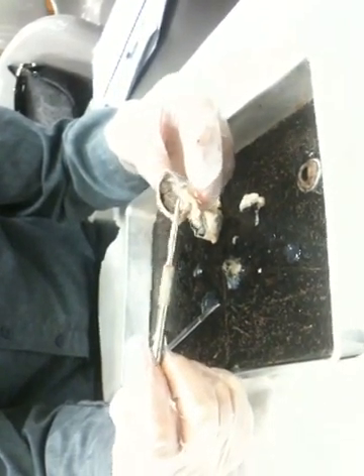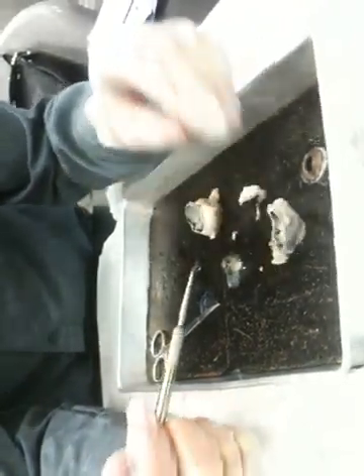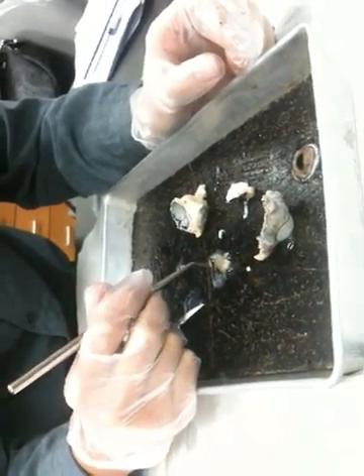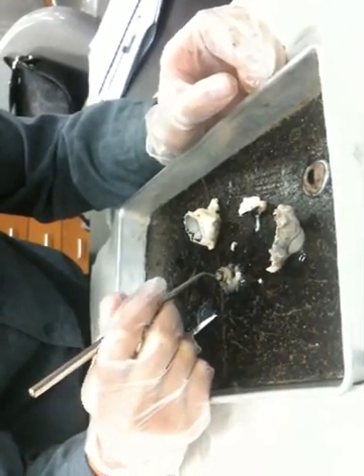So that would be the iris. Iris is again visible on this side, and you can see the ciliary processes of the ciliary body, ciliary muscles on this side. Looking back into the eye, then we can see just the cornea there clear with all the other material removed.